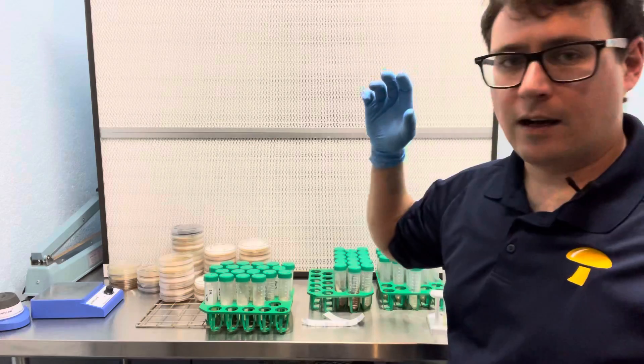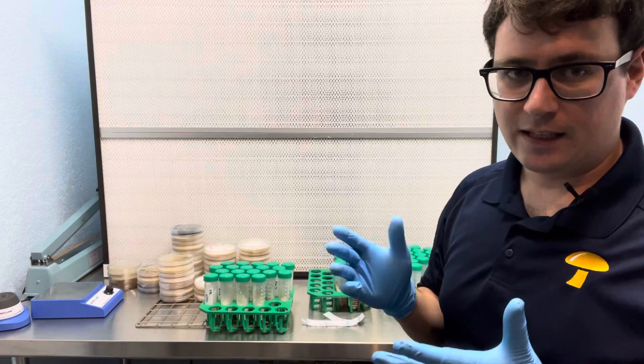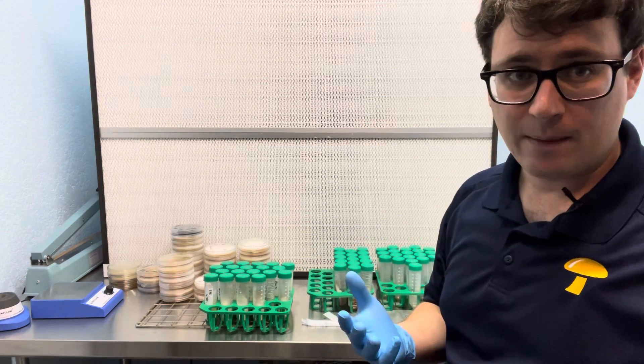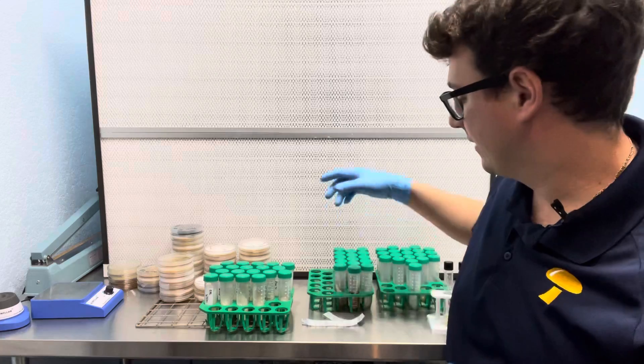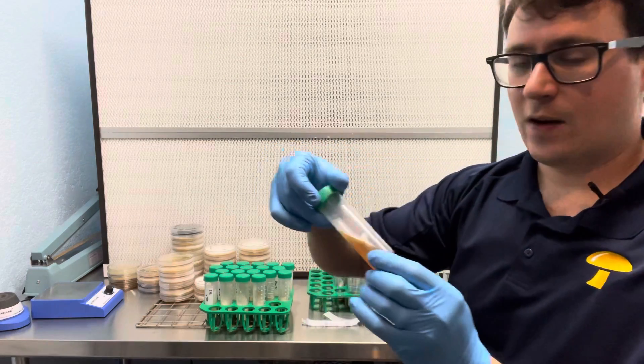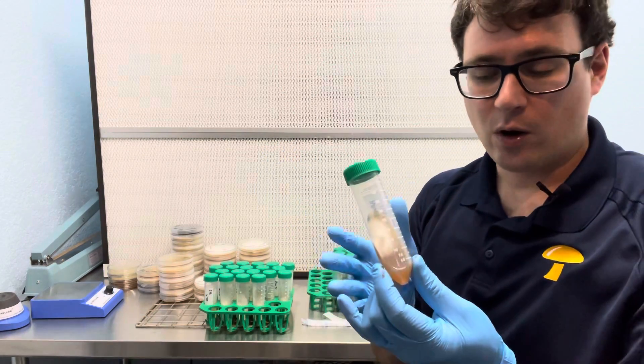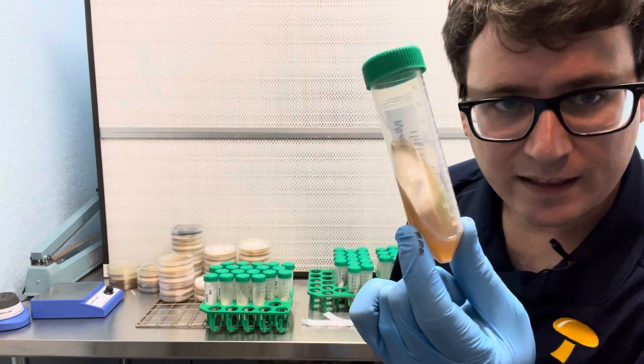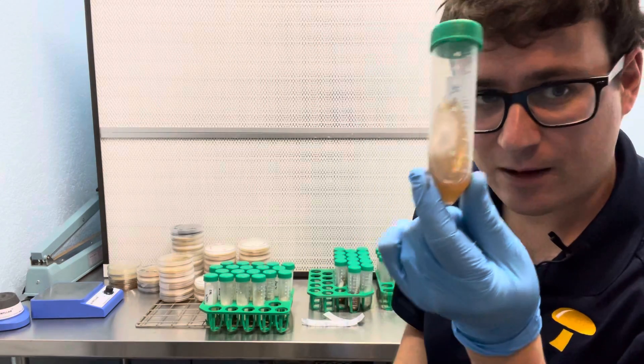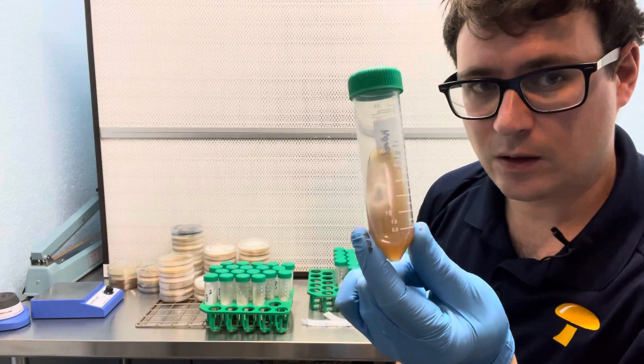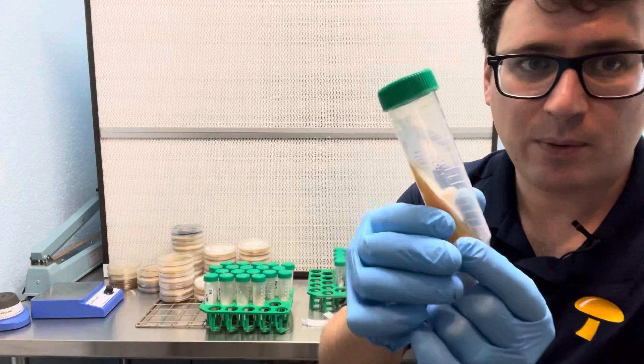So someone asked me recently when is a good time to put your slants into long-term storage. So I like to shoot for about 80% mycelial growth. This is more like 60 to 70%. I would wait a little bit longer with this one but if I was in a pinch it would probably be okay.